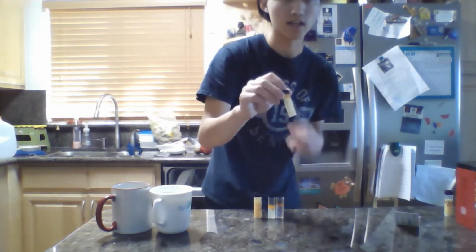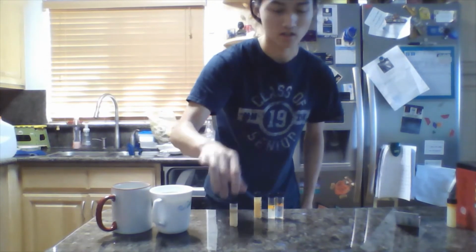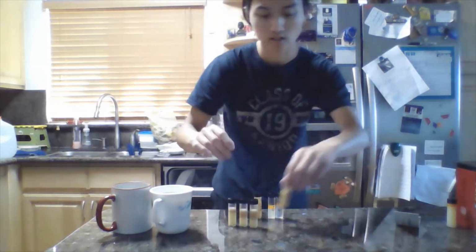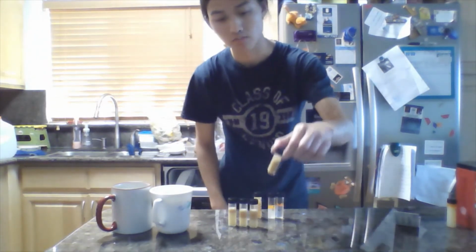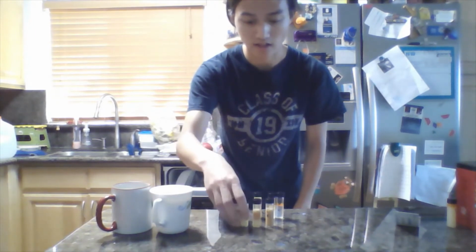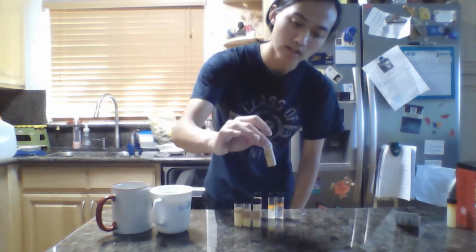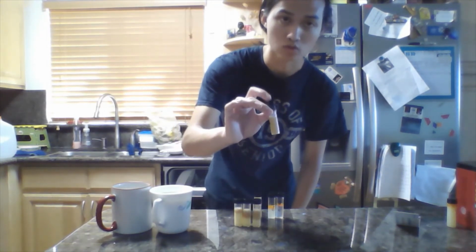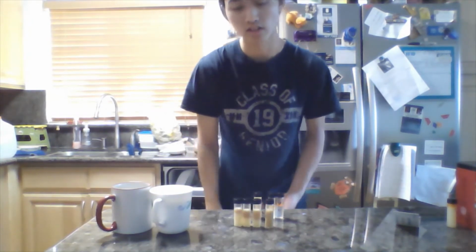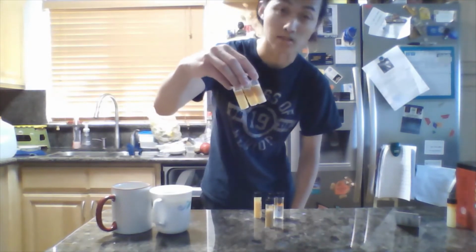And so as a test, I decided to use sesame oil and test various concentrations of sesame oil and water, with this one being primarily sesame oil and this one being primarily water. And as we can see, after I had added egg yolk into all of these vials, the one that was primarily oil was able to become a homogeneous solution, whereas all the other ones, which had a significant quantity of water in them, all of them stayed as emulsions.